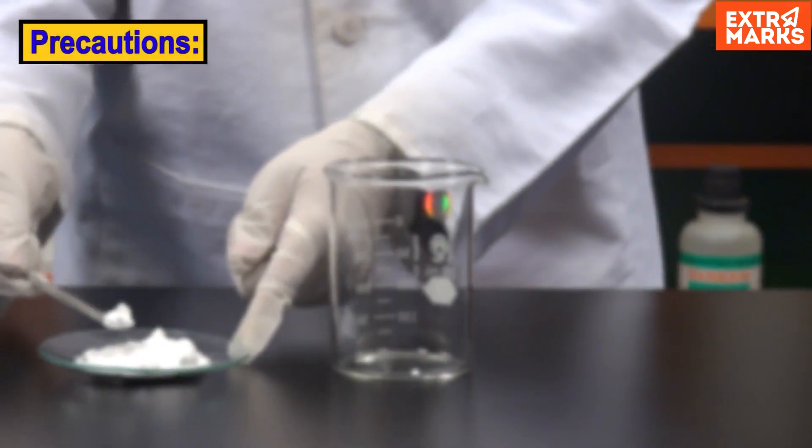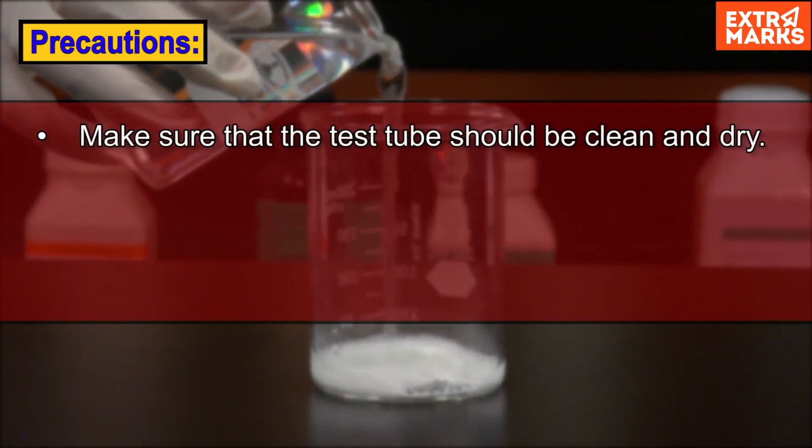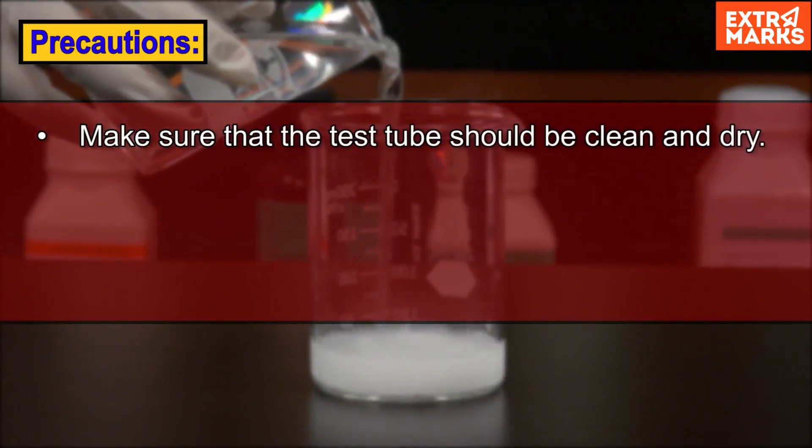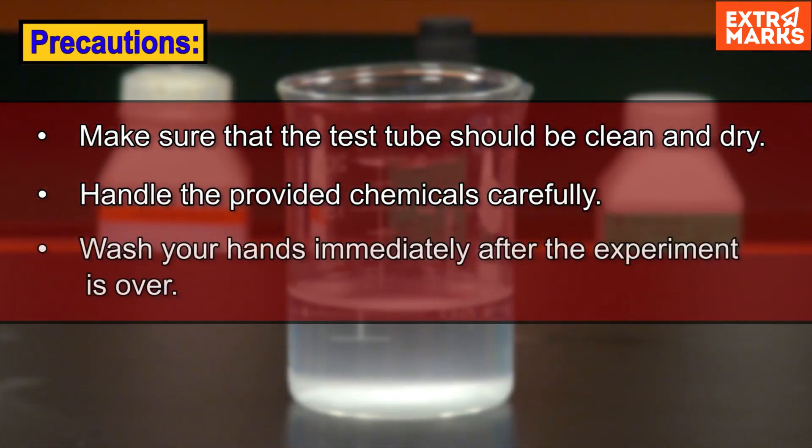Be careful while performing this experiment. Make sure that all the apparatus are clean and dry. Handle the provided chemicals carefully. Wash your hands immediately after the experiment is over.